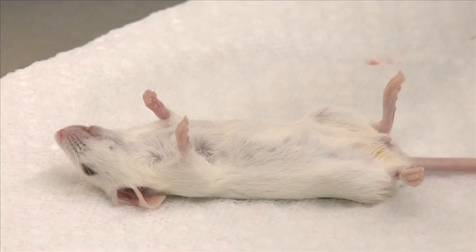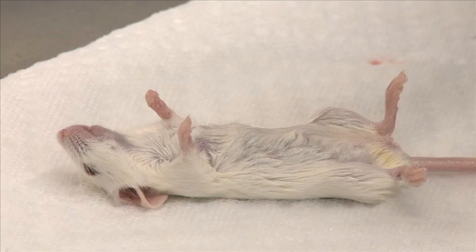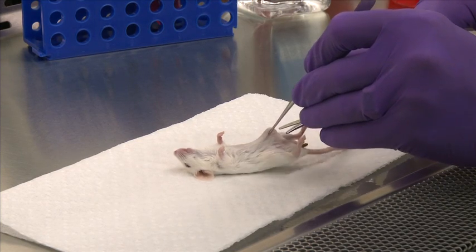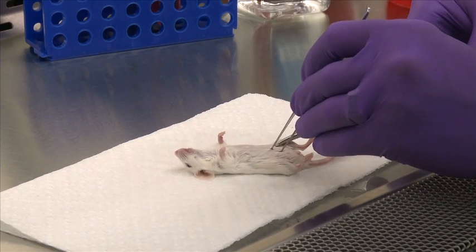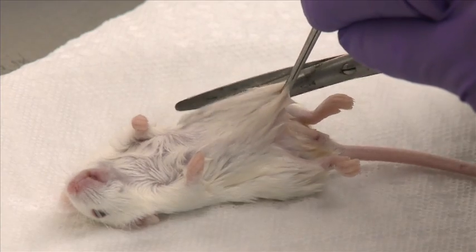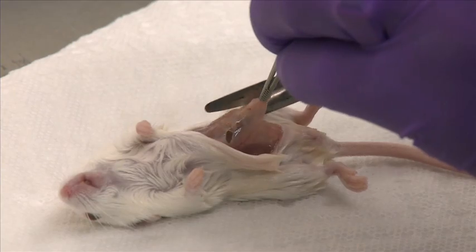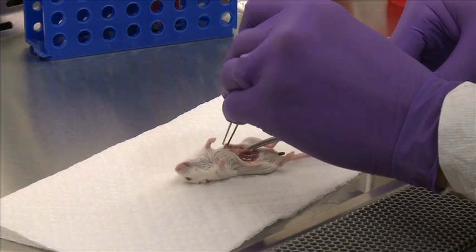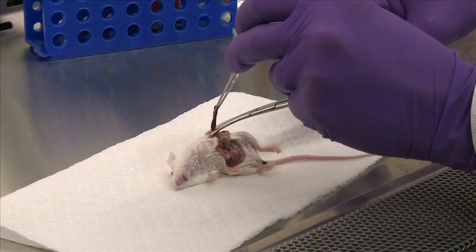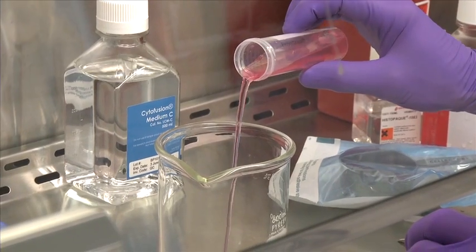After the mouse is euthanized, place the mouse on its back and spray down the surgical area with 70% ethanol. Using sterile surgical forceps and scissors, grab the skin around the area to be dissected with the forceps and make an incision in the muscle wall of the abdomen. Locate the spleen and remove it. Place the spleen into tissue culture media, then pour off the excess media.